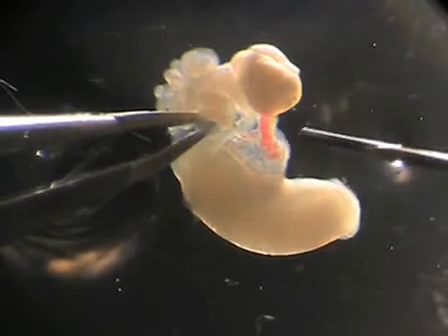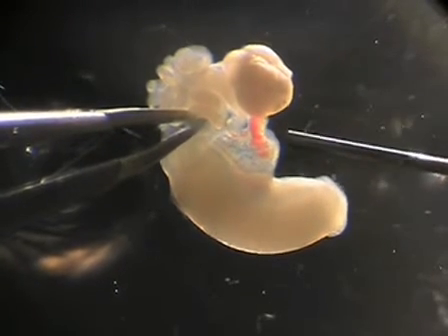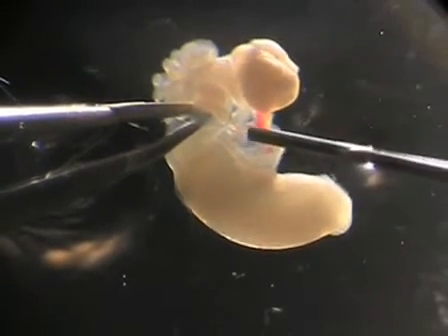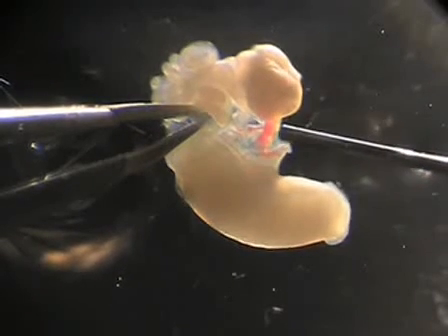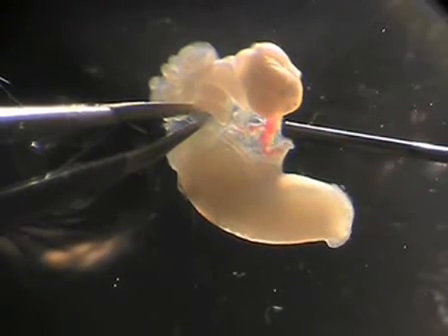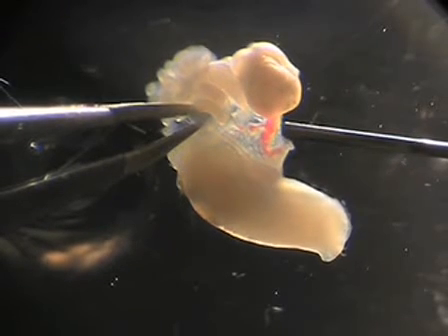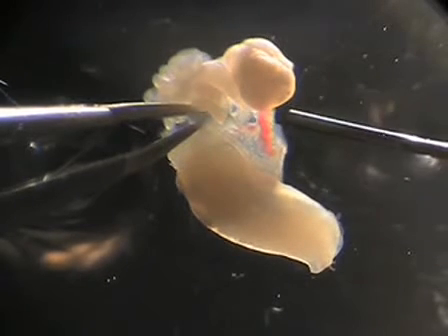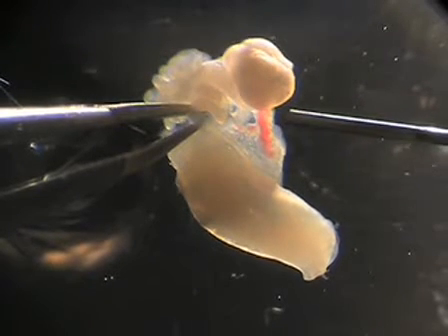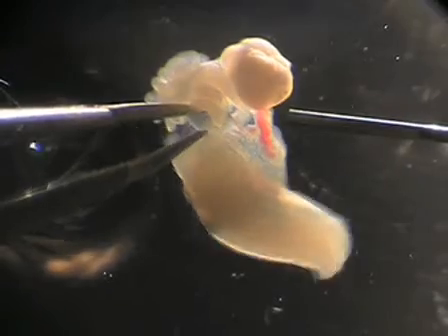My dominant hand is my right hand. In that I hold the 30 gauge blunt end needle. I use that as a forceps to isolate the infundibula. Once that is isolated, I will inject the blunt end needle into the infundibula and inject some liquid, which will flow out of the uterus. My left hand holds sharp forceps. This is used to isolate the infundibula and hold everything in place.